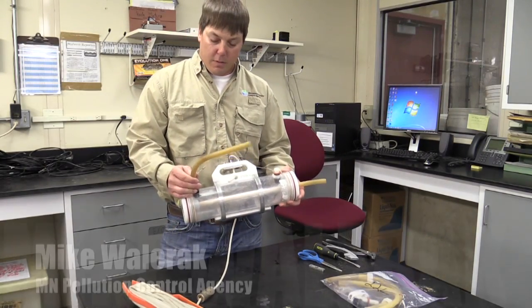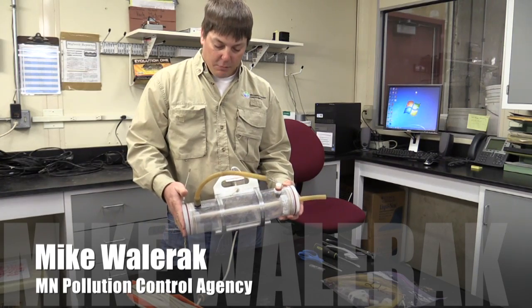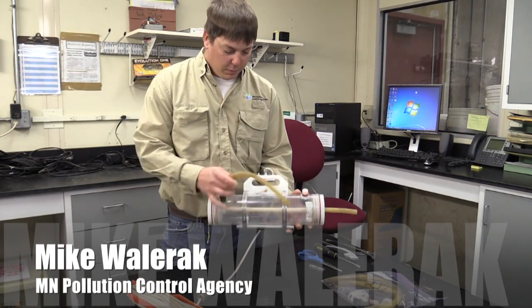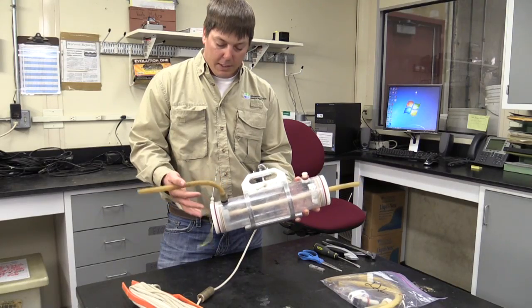Here's your Van Dorn sampler. I'm going to show you how to maintain and repair it. As you can see, this one's a little beat up. It's had a whole summer's worth of use on it.